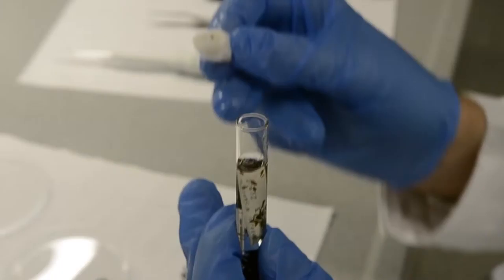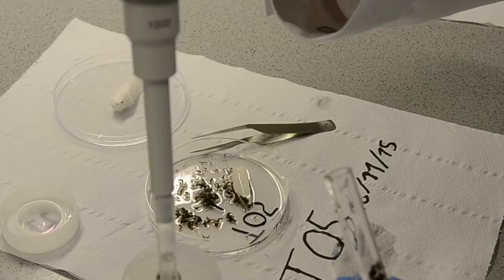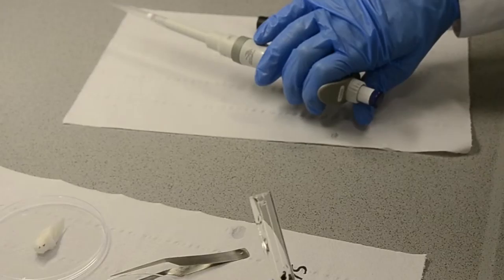Also, we have to be careful that we don't miss any specimens which might be in the cotton itself. The samples were poured onto the Petri dish. The ethanol from the sample was used to flush out the remaining specimens from the glass tube.